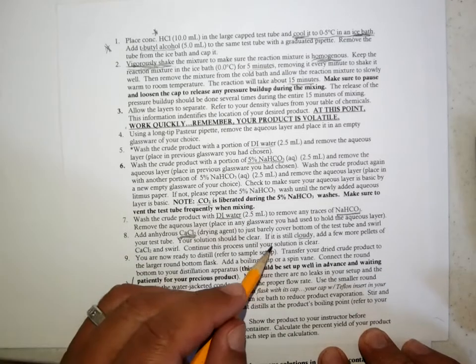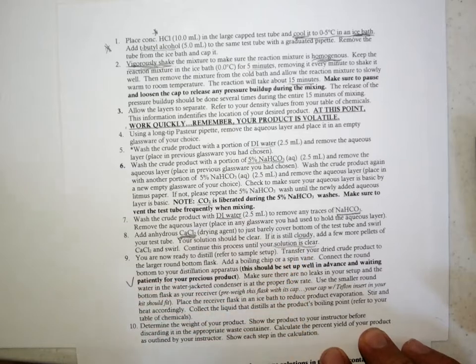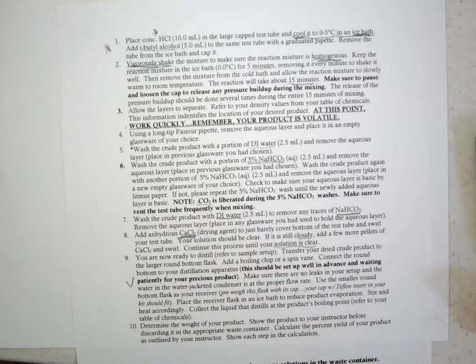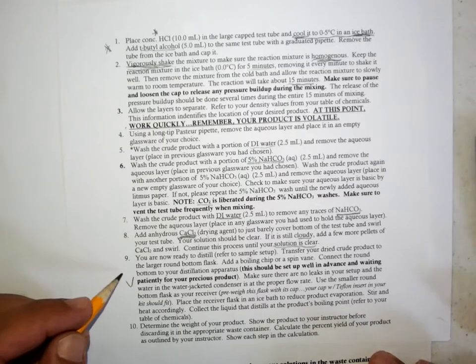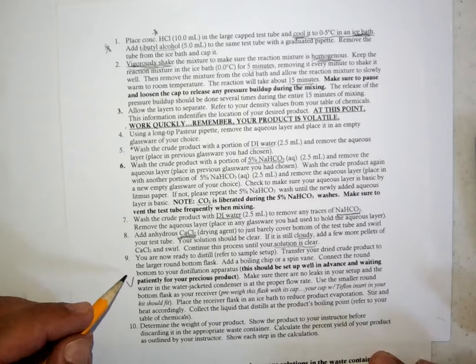And then when your solution looks clear, so when you can see through and it's not cloudy at all, it will be a clear colorless solution, then the water's generally been removed. Cloudy organic solvents typically are cloudy because they have water in them. We want to eliminate that water. And then we go ahead and do a simple distillation with our so-called dried crude product.